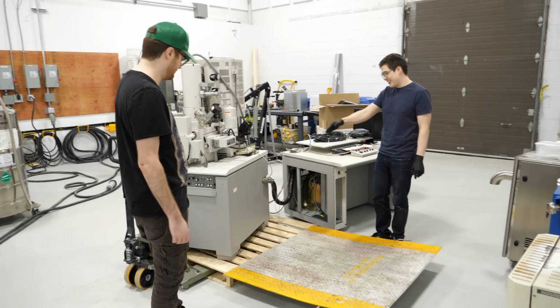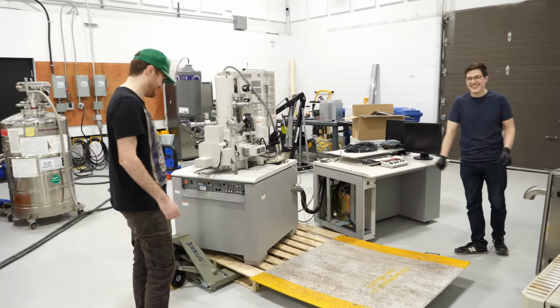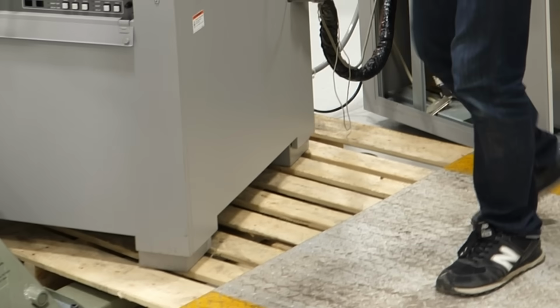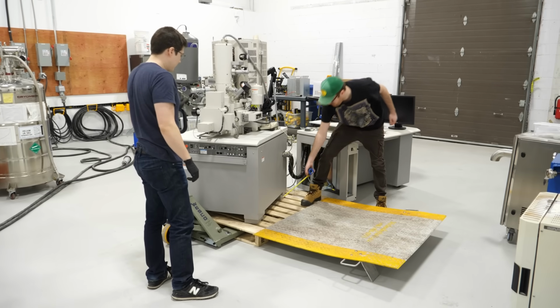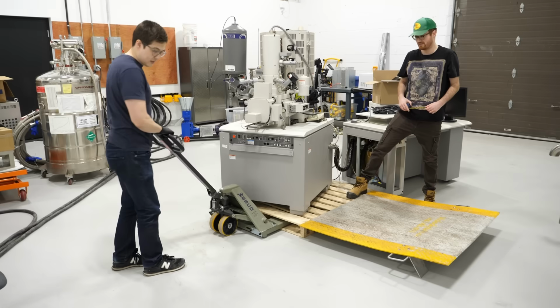Actually, the real trick... Cut the pallet? Yeah, you cut the pallet, so all the wood is angled. That's how we have to do it. But step one is, can we get this to fit into this? So this is 21 and a half inches, and this claims it can get to 21. So that's stage one.